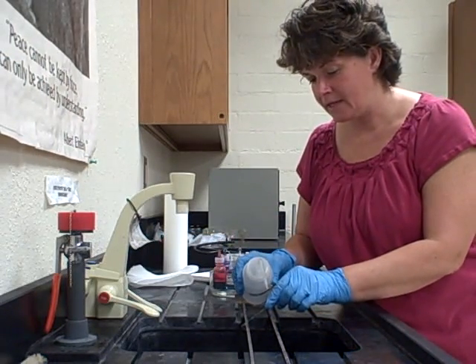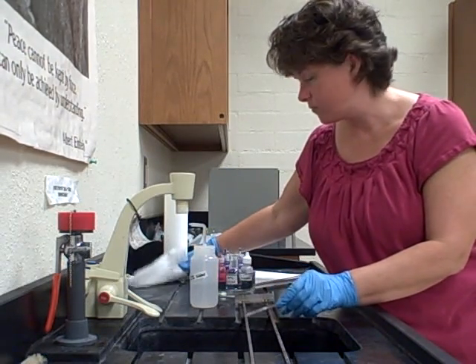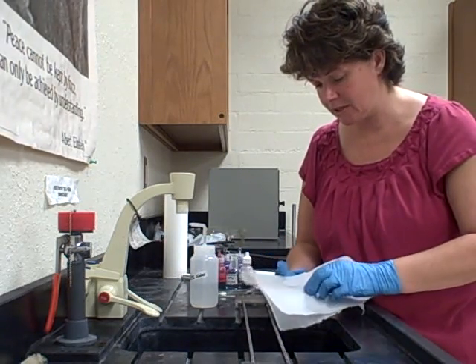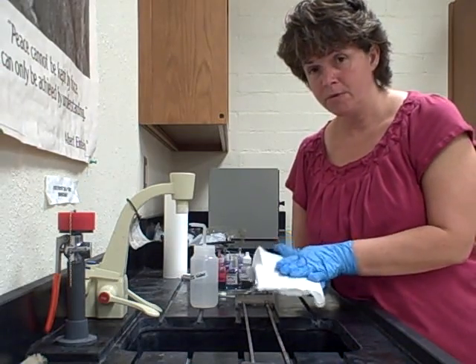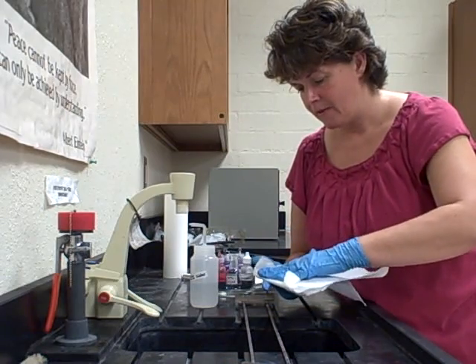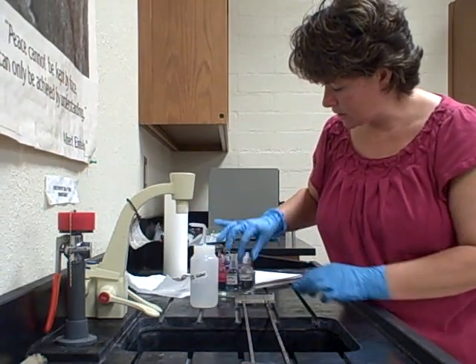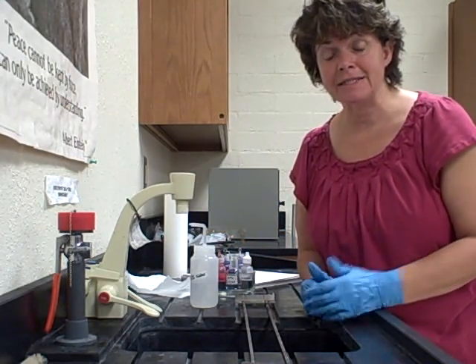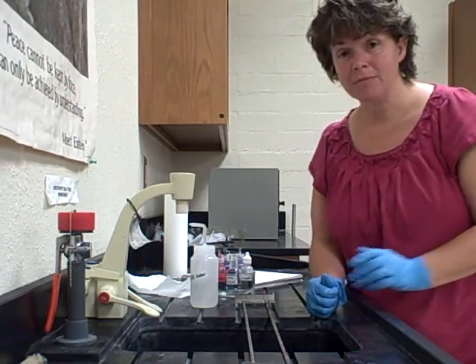After the safranin has sat, rinse with water one more time. We've worked really hard at this, so we don't want to take all our stain off or lose our bacteria. Dry the bottom first, fold the paper over, and gently blot dry. It doesn't have to be completely dry right away — you can tilt it and let it dry on its own. The key is it must be dry with no excess stain when you put it on the microscope. That was the gram stain procedure.